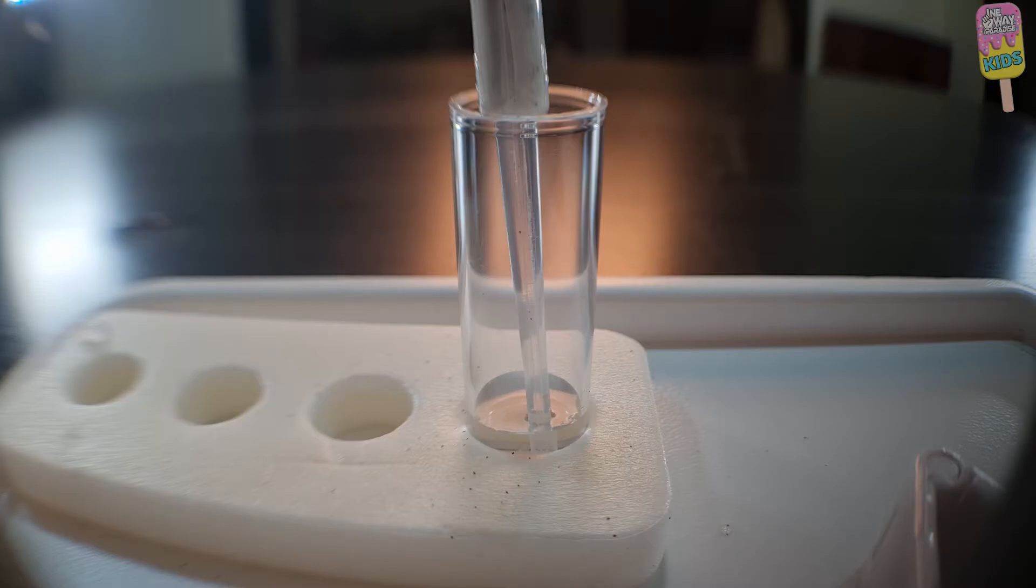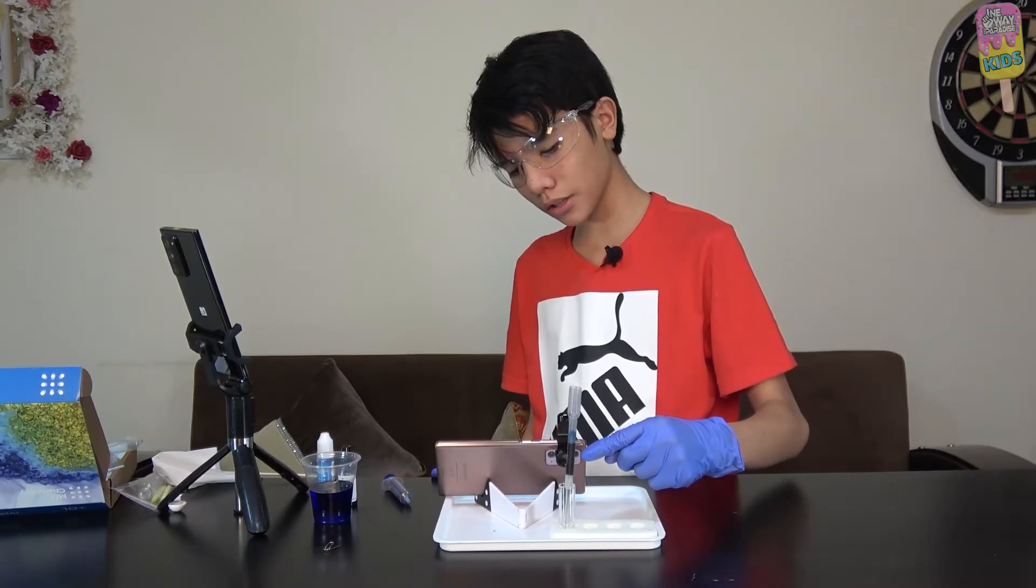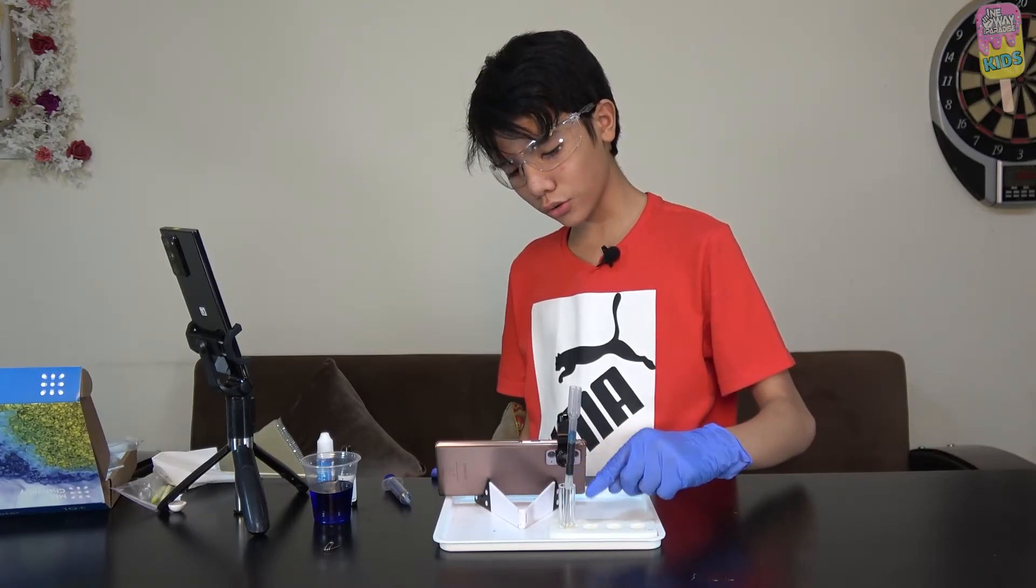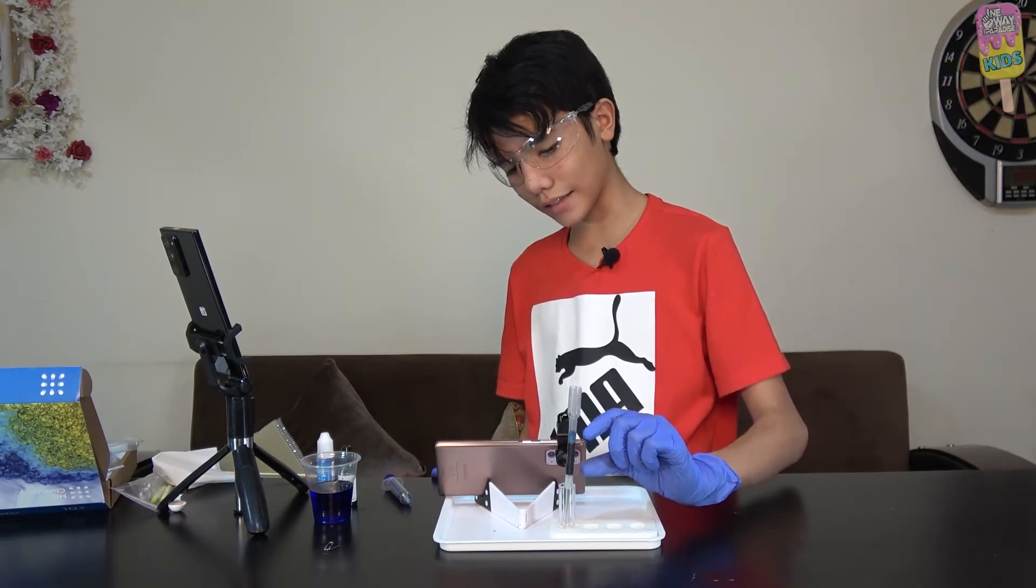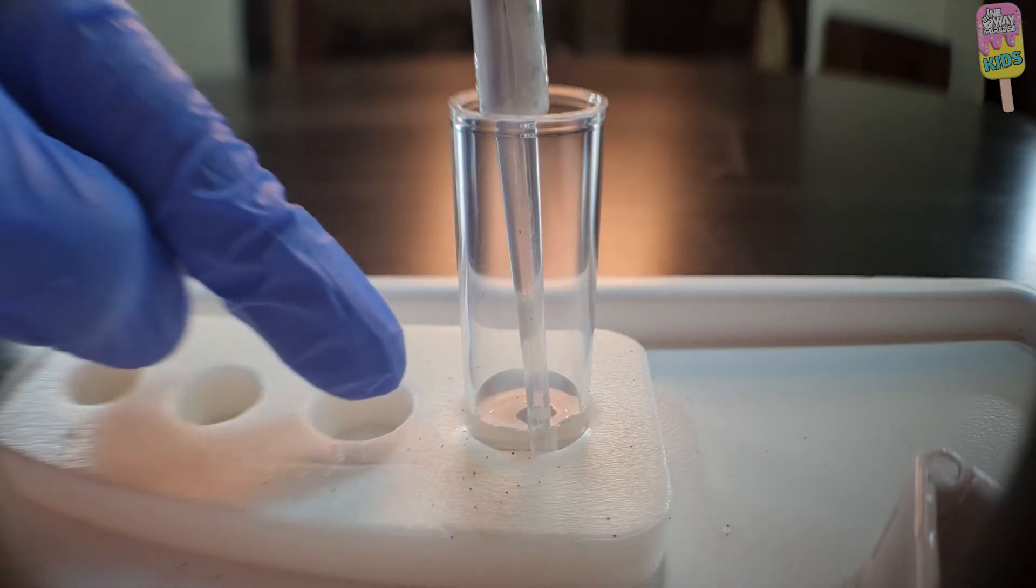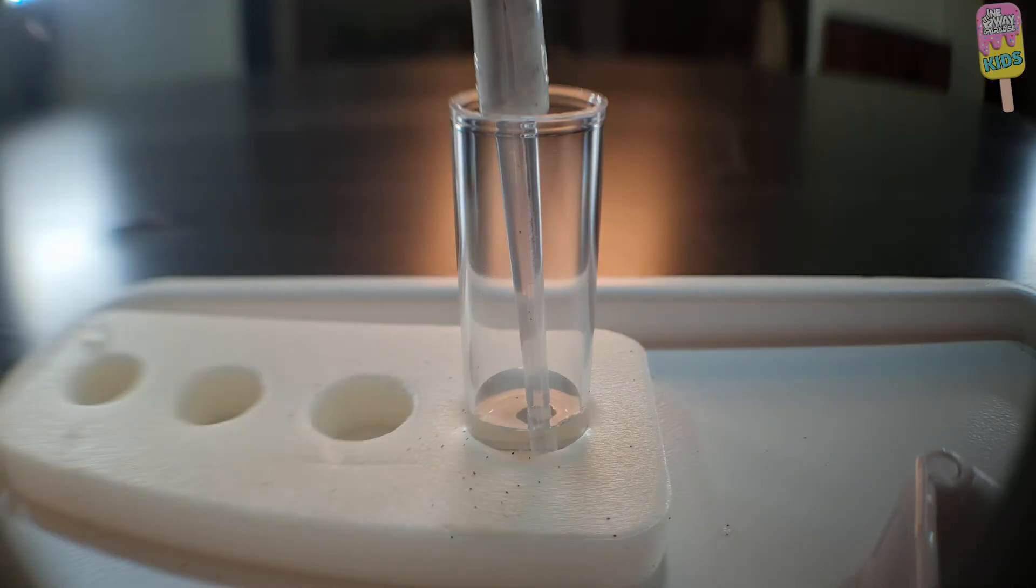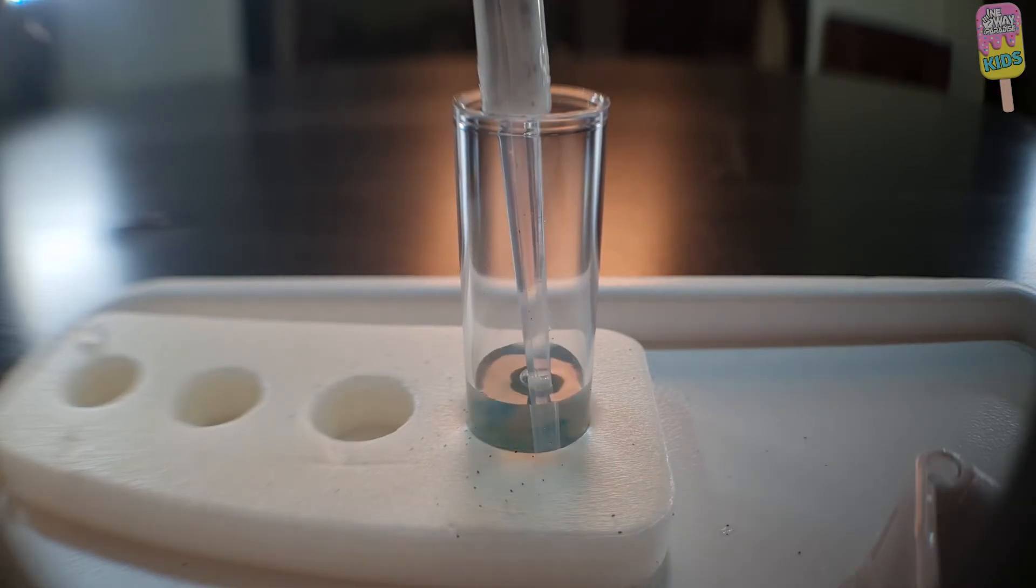I think it's working now. Our methylene blue solution is now passing through the cotton cylinders and through the activated carbon. Now what's happening here is that this is acting as a filter, and it's filtering the water. That's why the water is looking a bit clear, which is pretty amazing to turn that inkish blue into plain water. Oh no, some methylene blue just rolled into the water.